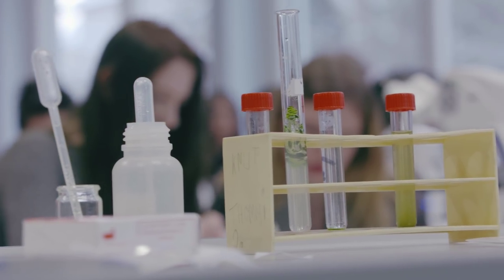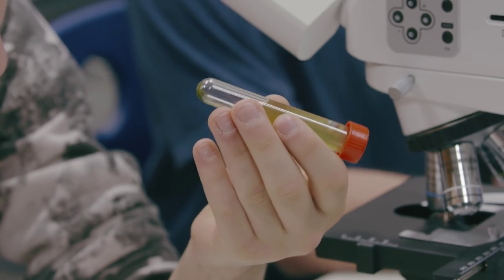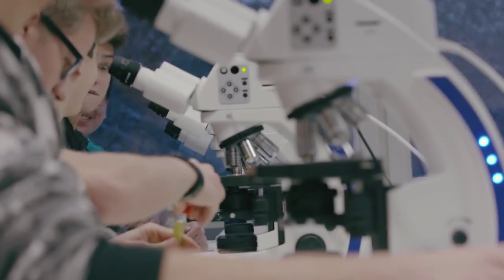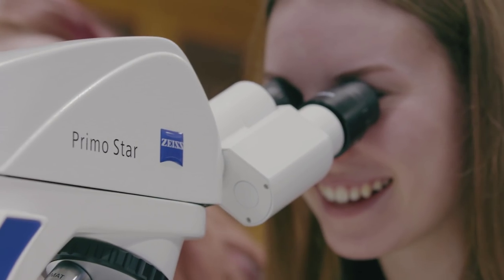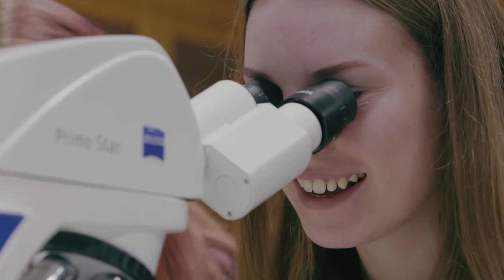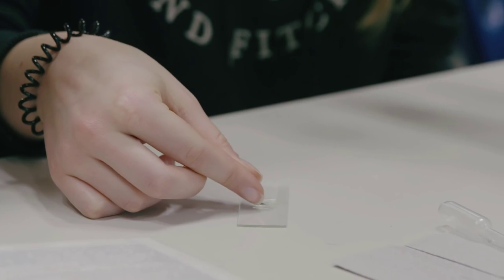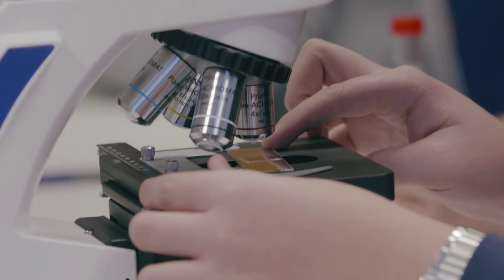The goal for today's exercise is to determine the water quality of a lake using the planktonic organisms present. To do this, it's especially important that we work with powerful microscopes that provide us with high contrast at an excellent resolution.